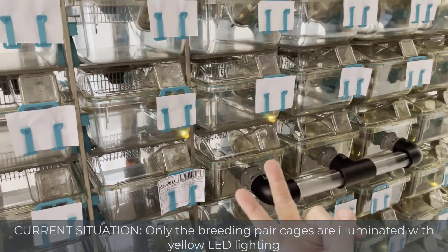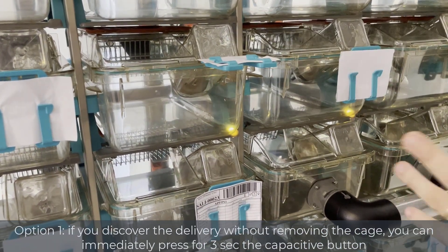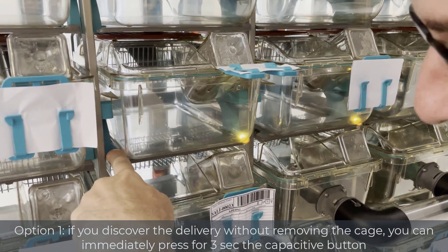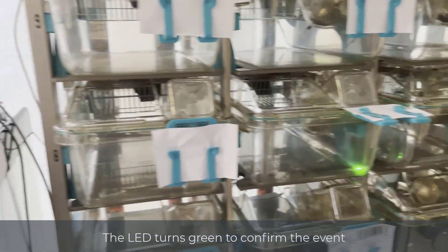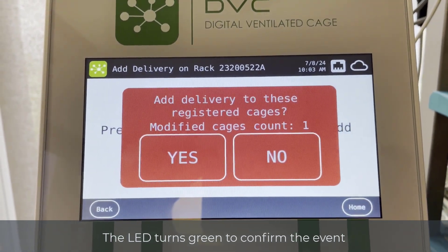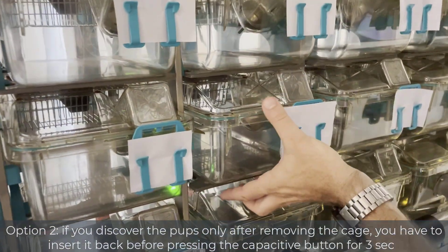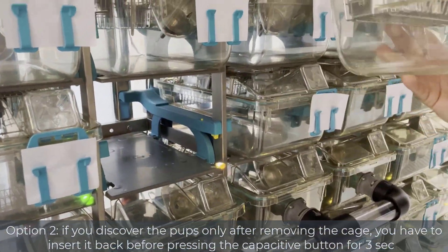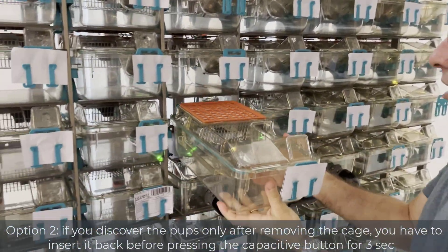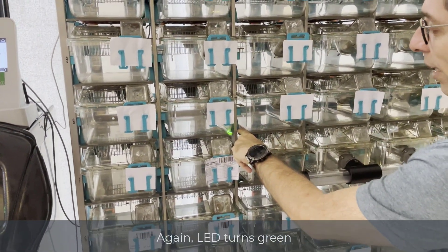You have two options for telling the system that there are pups and a delivery should be added to the corresponding cage. You can keep pressing the button without removing the cage, simply because you were able to see the pups through the plastic — the system confirms there is already one cage without a delivery. Or you can remove the cage, check carefully, insert it back, and keep pressed for three seconds as well.